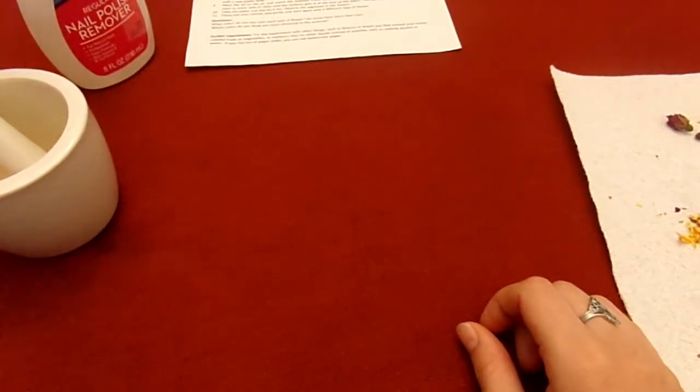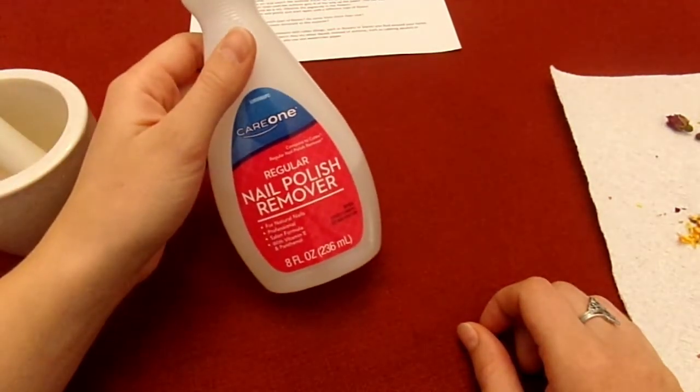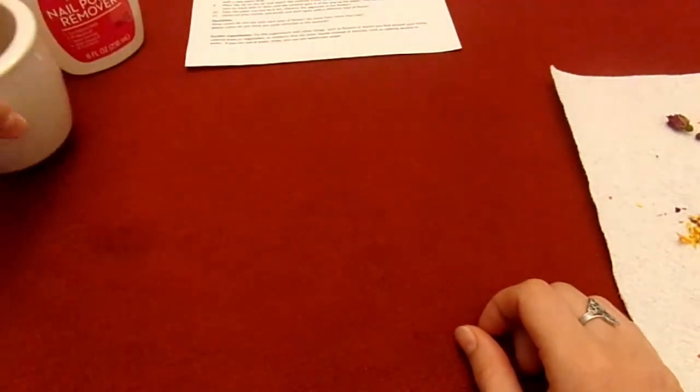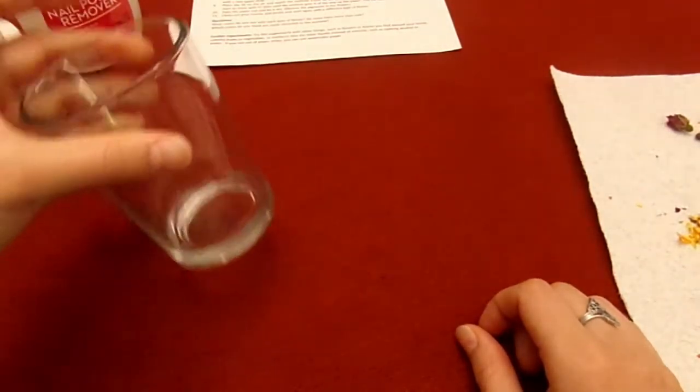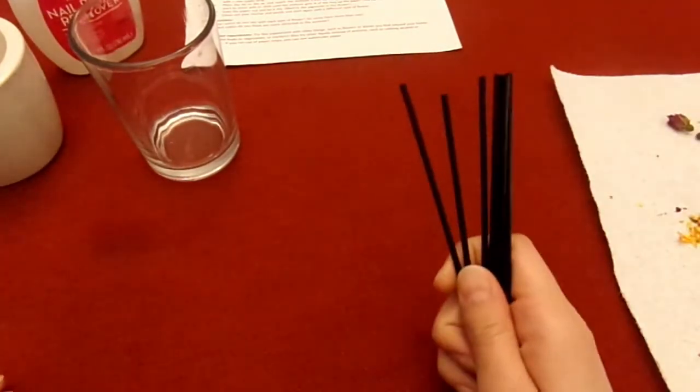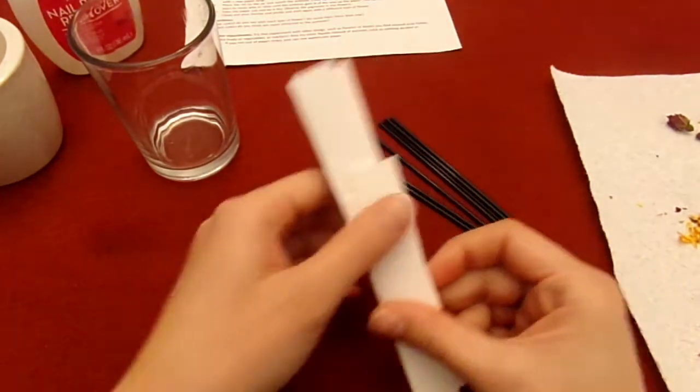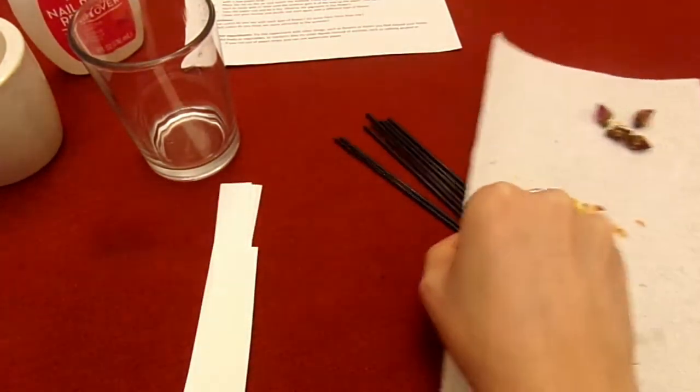What you'll need for this experiment is acetone, spotters, paper strips, and different types of flower petals.